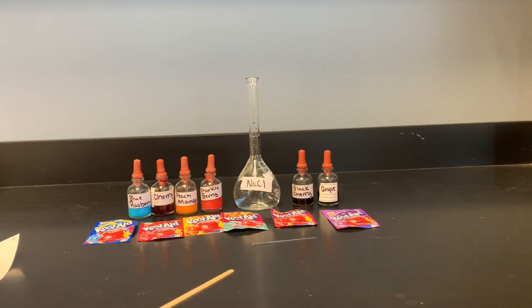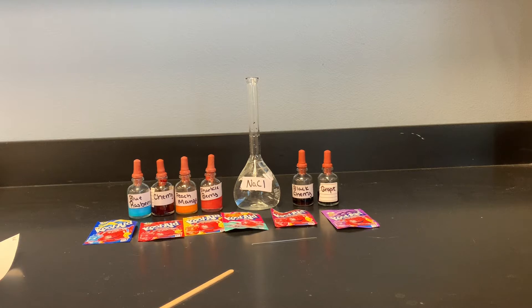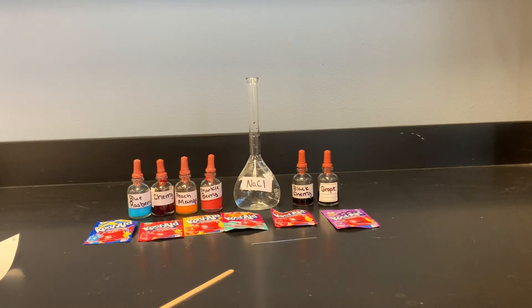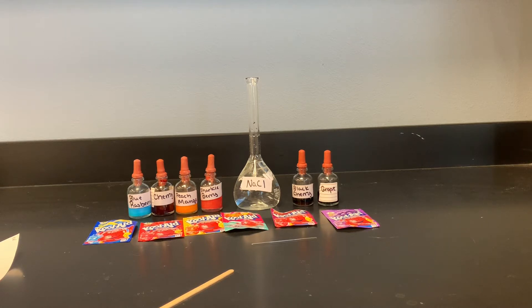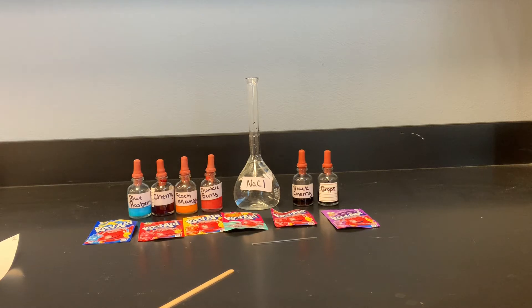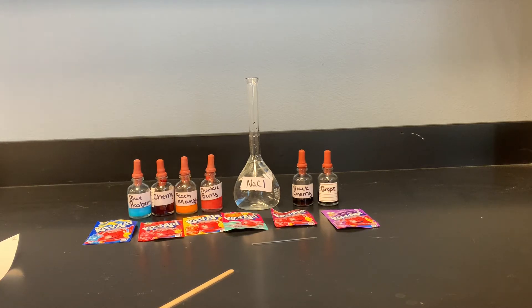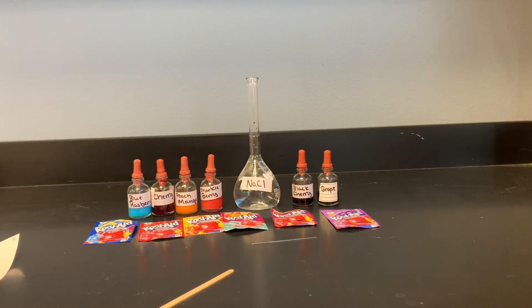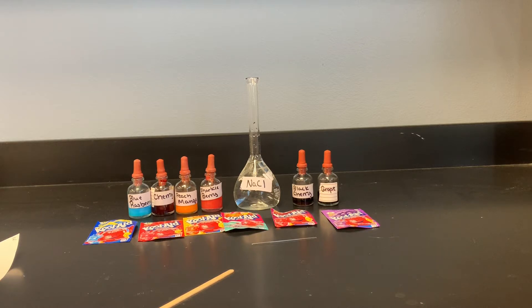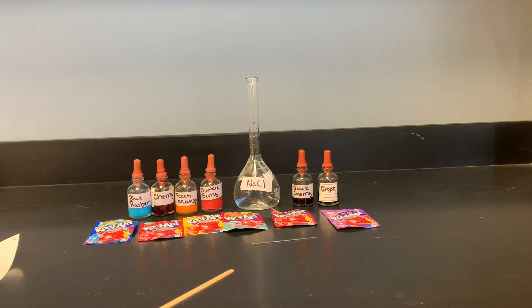A strip of paper, the solid phase, is treated with a liquid mixture which appears as a thick dot at one end of the paper strip. The mixture is allowed to dry. The paper is then dipped into a solvent, the liquid phase. By capillary action, the solvent is drawn up through the paper.